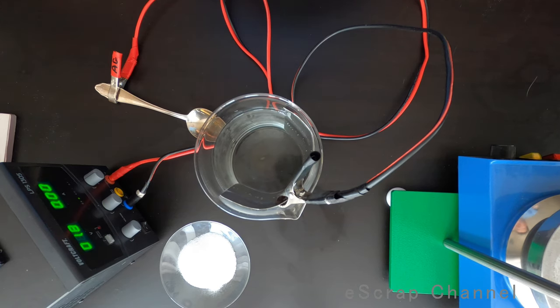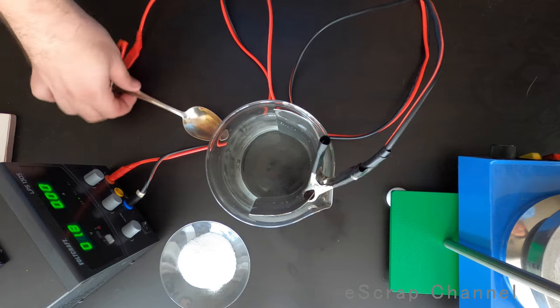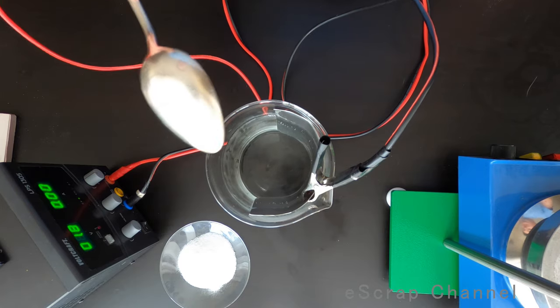Hello Scrappers! Let me show you today how to do reverse electroplating and it will be silver reverse electroplating.